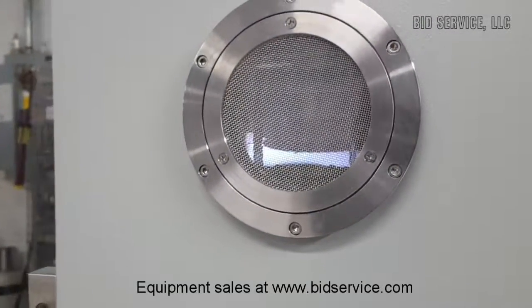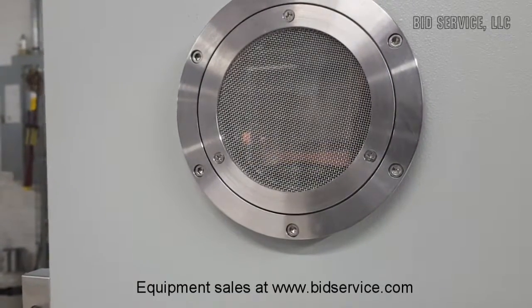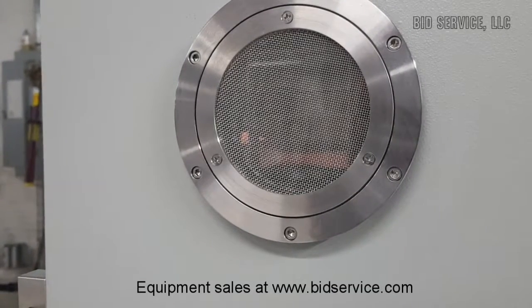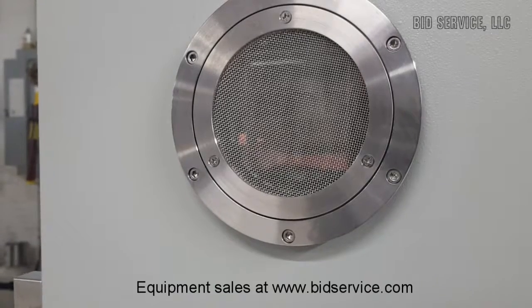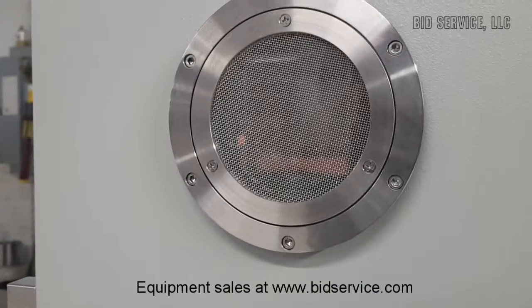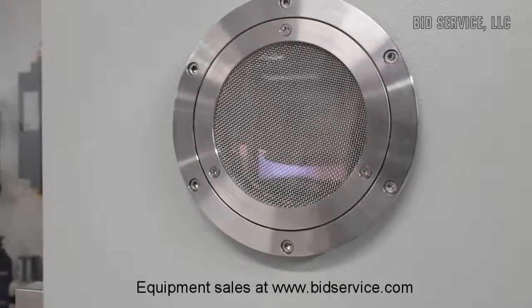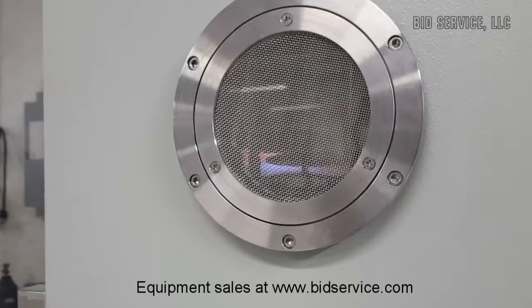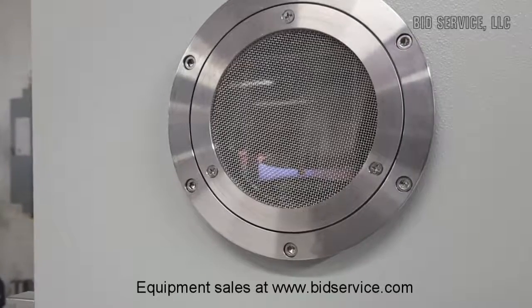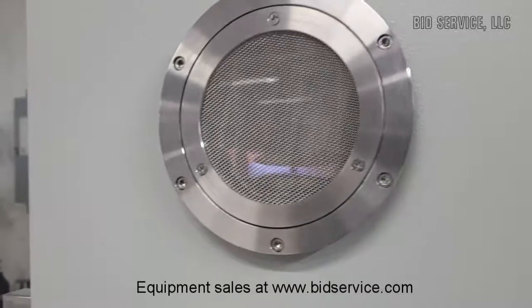Since we're on target 1, I'm going to go and do DC. You'll be able to confirm that all three targets work as well. I'll shut the heat off so you guys can see it a little bit better, since it makes it harder to see.